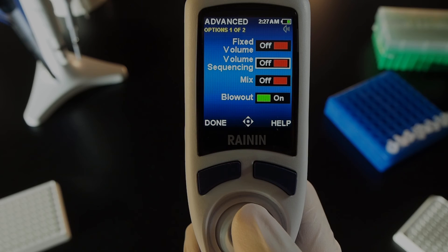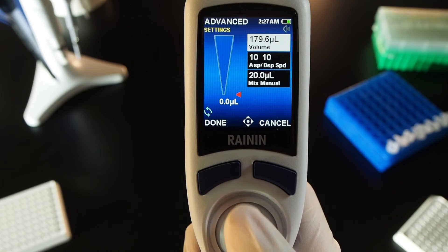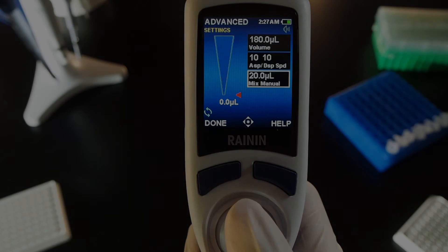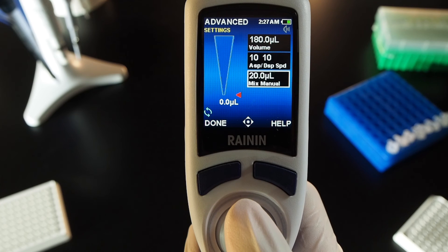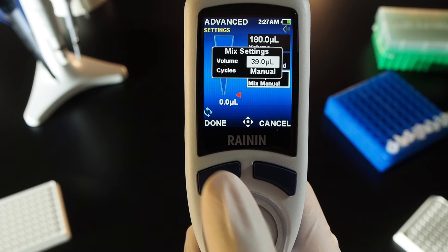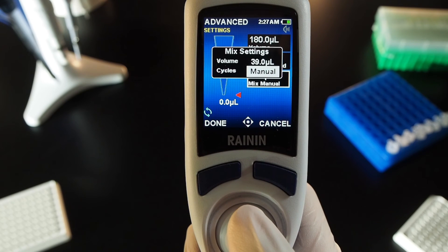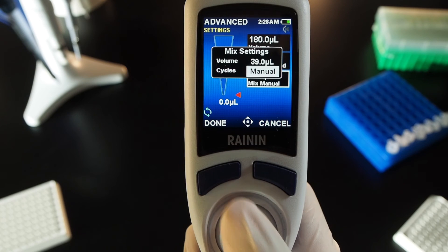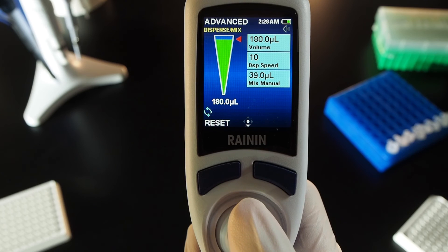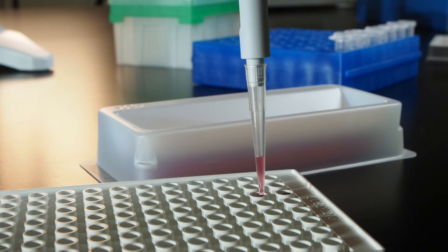Mix. In options, joystick to mix and press the joystick in to turn it on. Press done. Joystick right to go into settings. You can adjust volume, cycle speeds including mix speed, and finally mix settings. With the bottom box lit, press the joystick in. Press the joystick again to highlight mix volume. Move left or right, up or down. Press done. Move down to cycles. Press the joystick in and set the number of mix cycles. Manual means the pipette will mix continuously until you release the joystick to stop it. Press done to exit mix settings, then press done again to exit settings and run the volume. Joystick up to aspirate, down to dispense, and continue holding down if using manual mix. To halt, release the joystick upward.